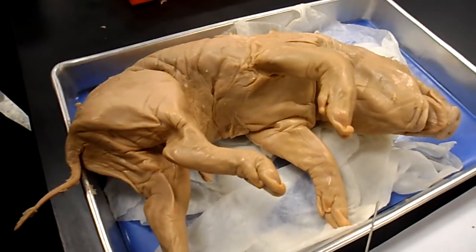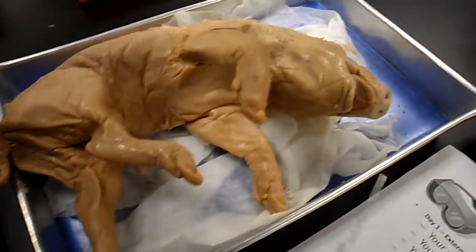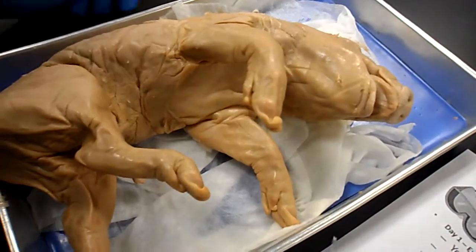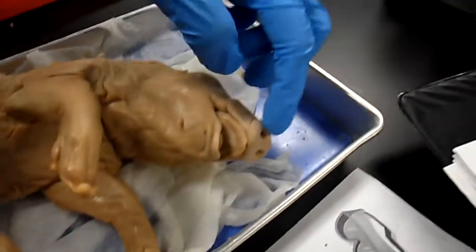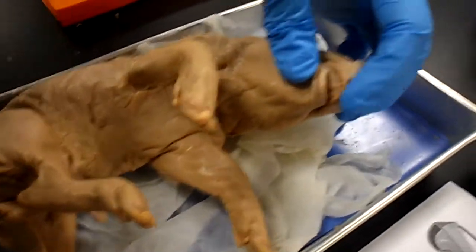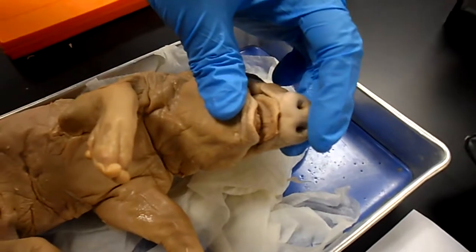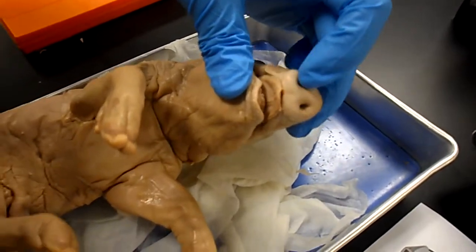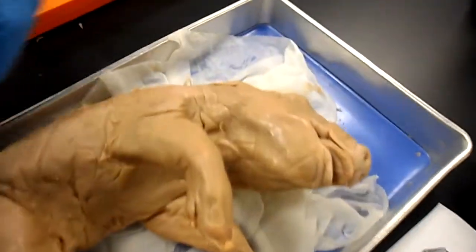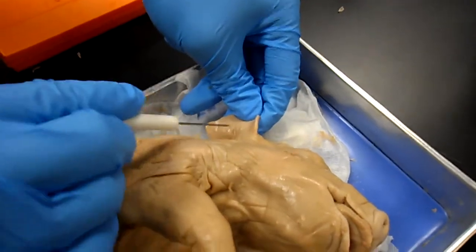External features: the cranial region is this area right here, the head. The snout is right there, and the external nares are these two holes right here. And the pinnae.